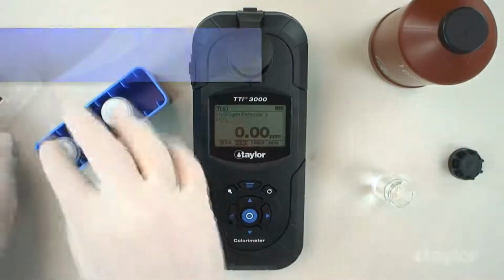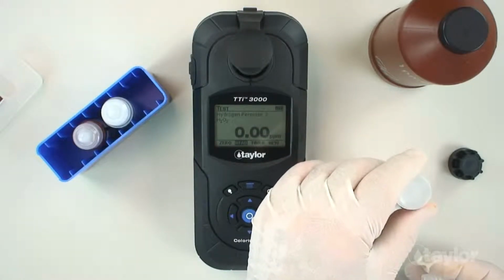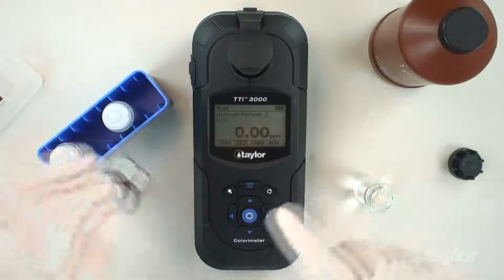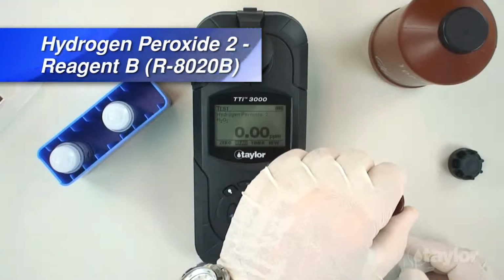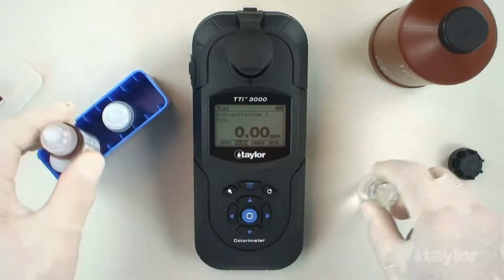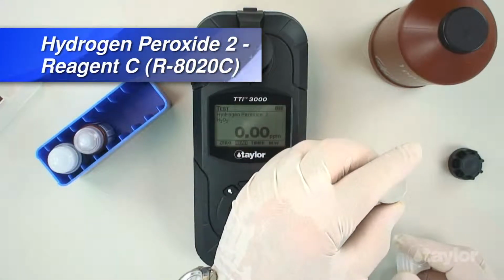Add 5 drops of hydrogen peroxide 2, reagent A, then swirl to mix. Add 5 drops of hydrogen peroxide 2, reagent B, then swirl to mix. Add 5 drops of hydrogen peroxide 2, reagent C, then cap and swirl to mix thoroughly.